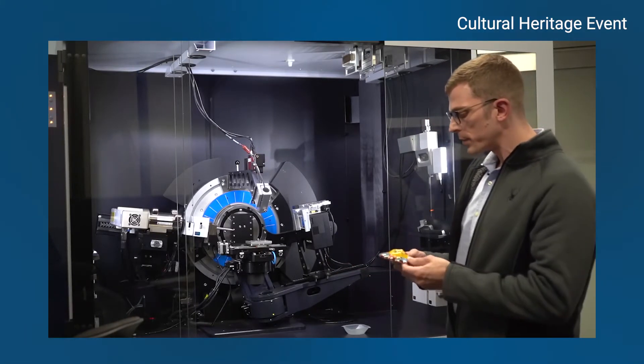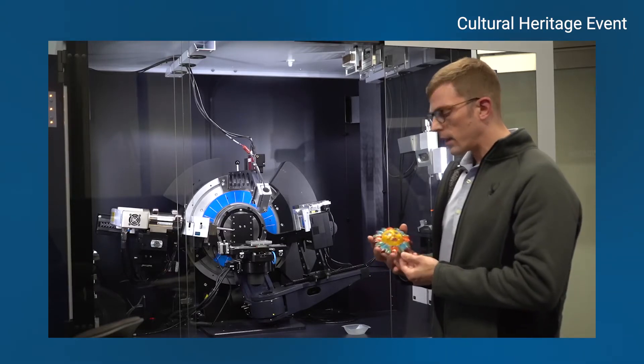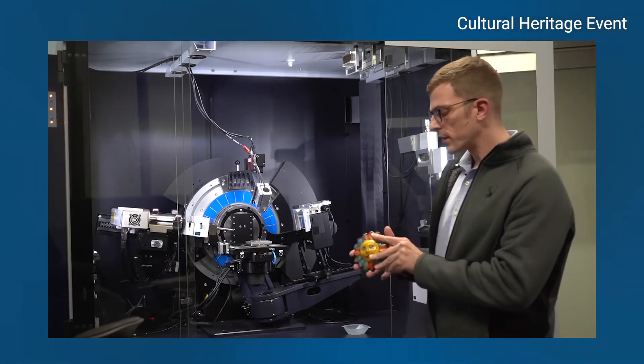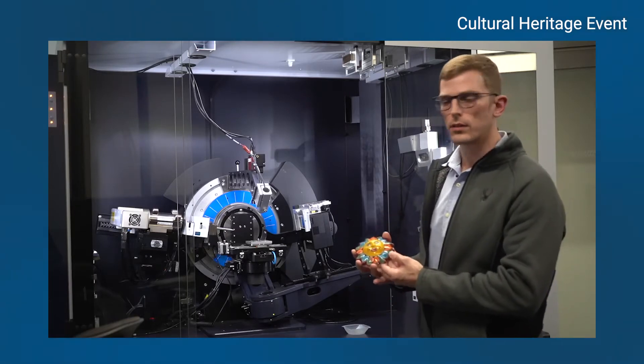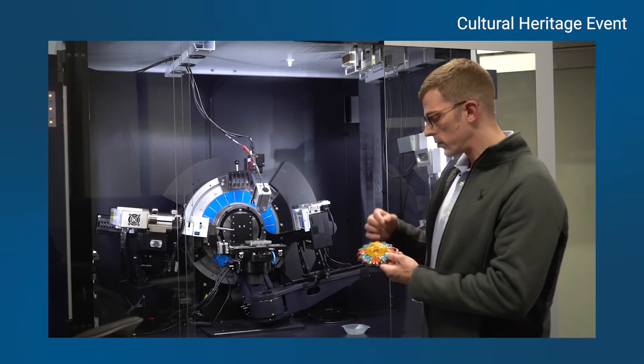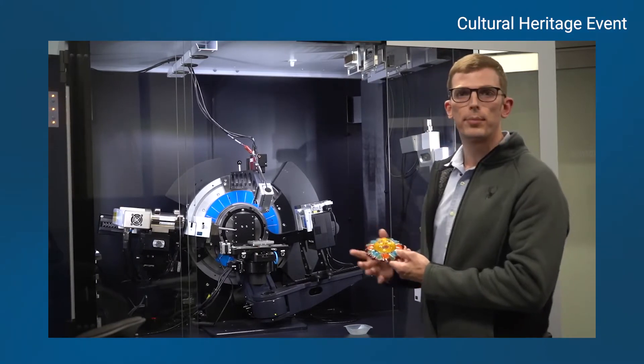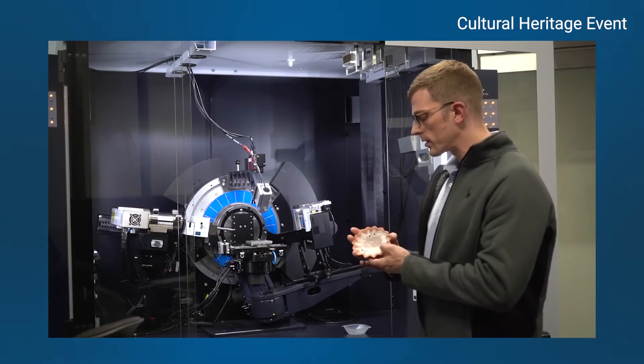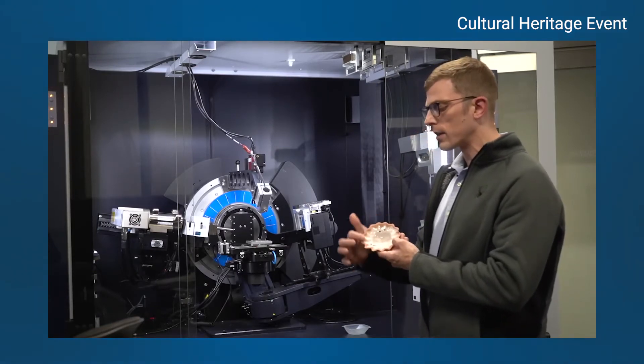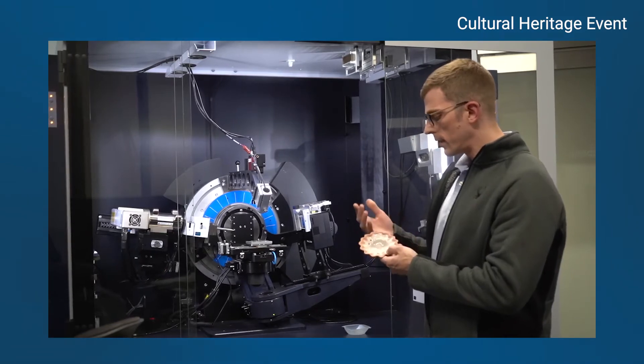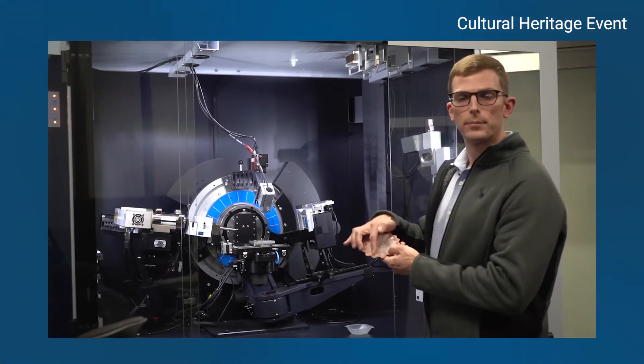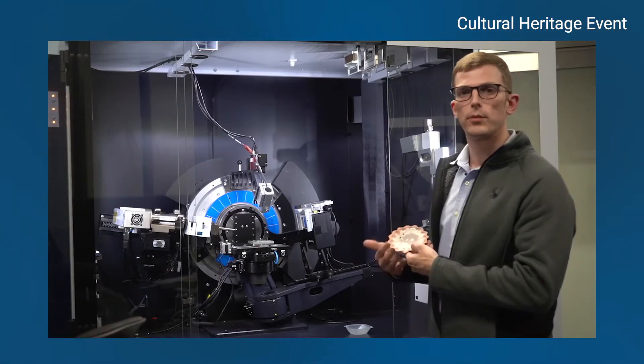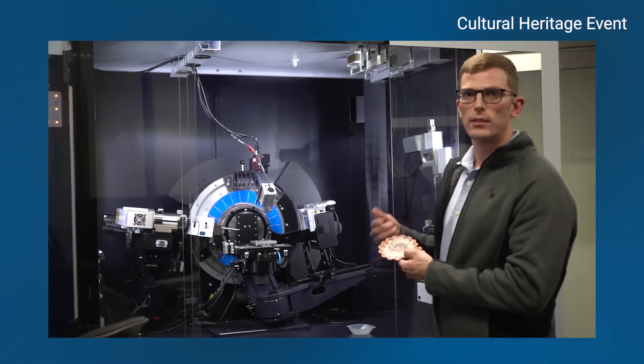So for this particular artifact, we can see there's a front side and a back side. The front side is all glazed, painted with different colors. One thing we could do is look at each color and see what the different pigments are. Or if we turn it around, there's actually a part that's not glazed at all around the outside of it. We could measure just the bare ceramic and then drive next to it onto the glazed part and see if we find anything different on the glaze compared to the unglazed regions.